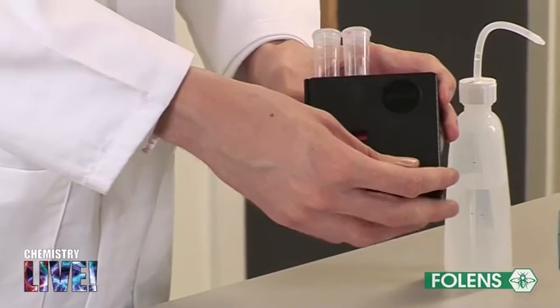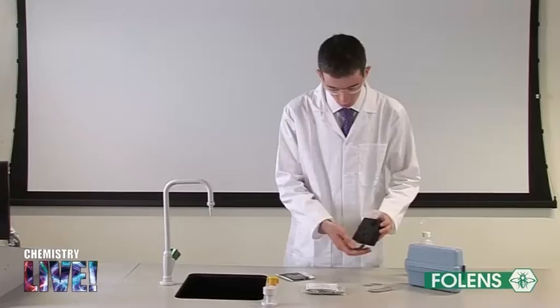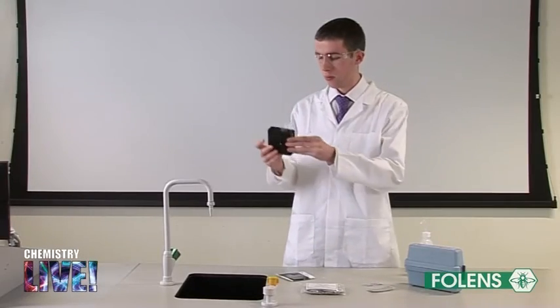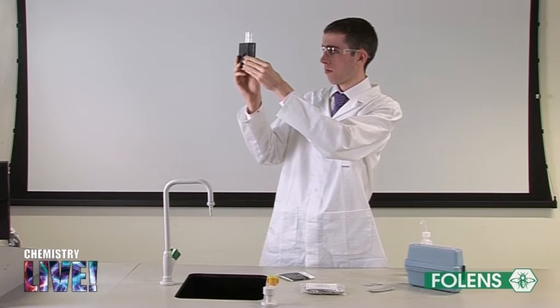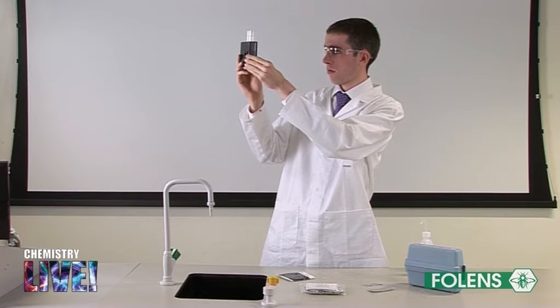Close the lid of the comparator box. Hold the comparator box up to a source of white light, for example a lamp or a window and view the two openings in the front of the box.